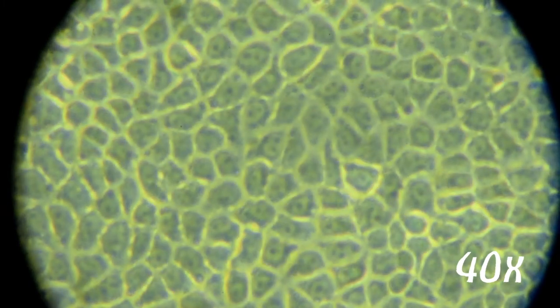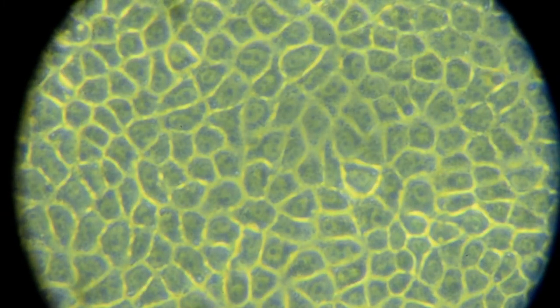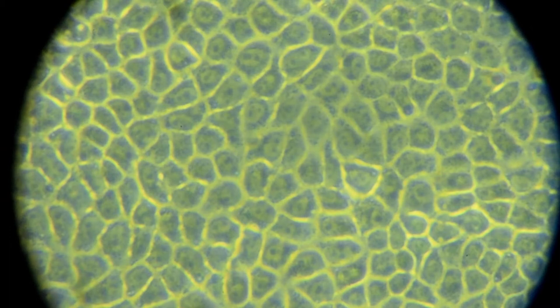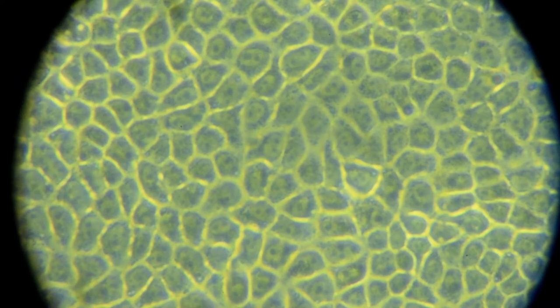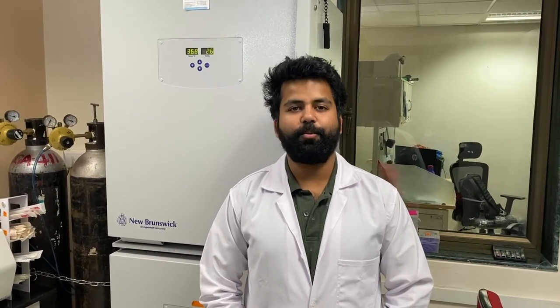The bigger circular structures visible inside each cell are the nuclei. The nucleus acts like a brain for the cell — it controls the major functionality of the cell. There are other structures inside the cell, but we won't be able to magnify further with this microscope. If you want to see more, you can talk to our microscopy expert, Satya.